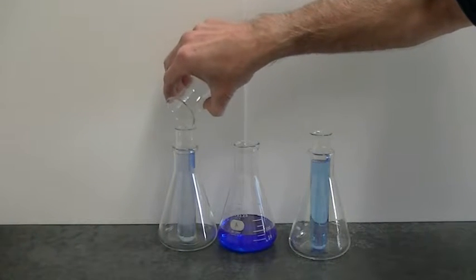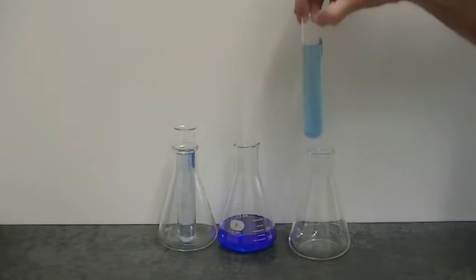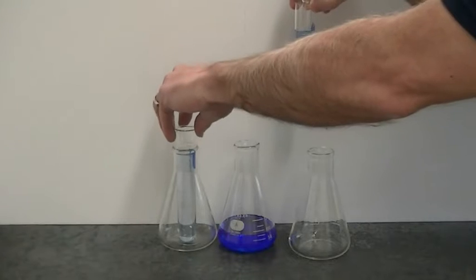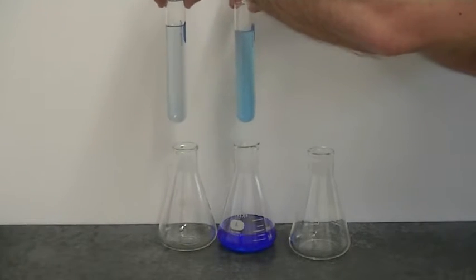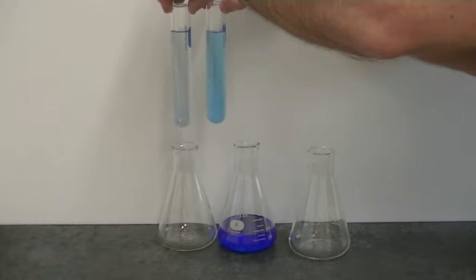In this case, we see the color fade and almost disappear. So if we compare our two samples, our control sample and the sample to which the alcohol has been added, we see quite the difference.